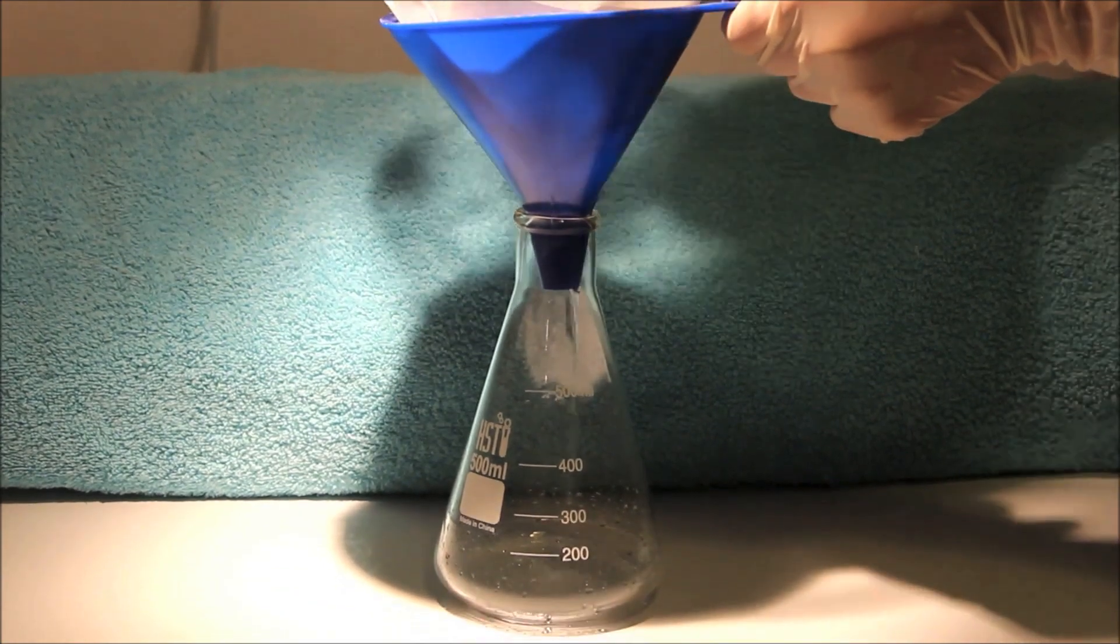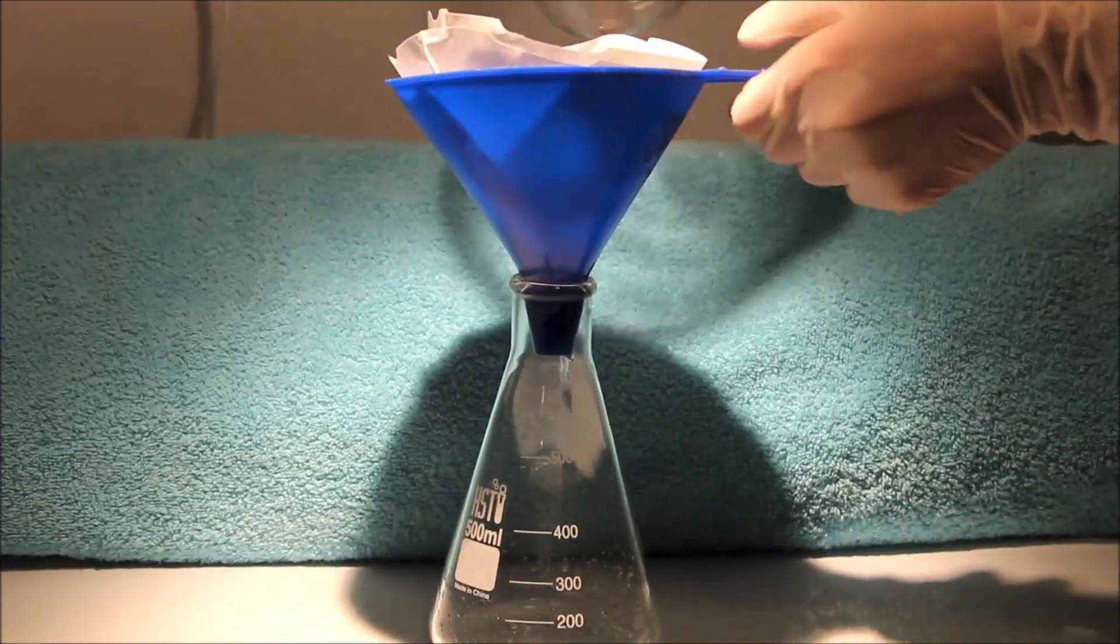The solution being filtered out here is a solution of zinc chloride, which is needed for the next experiment I will show.